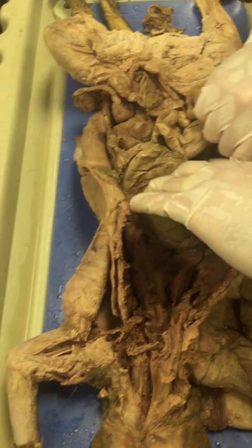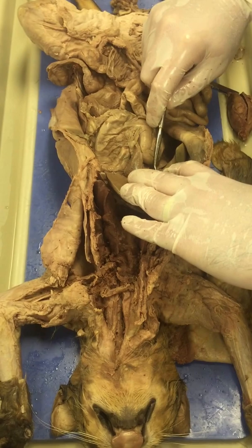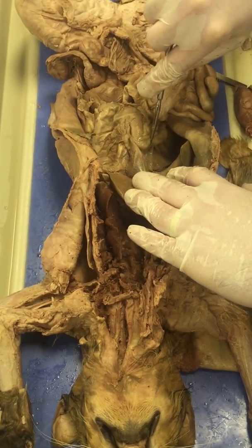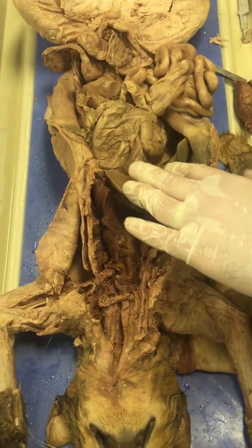And from the gallbladder, bile is released through the bile duct, which you can see right here. Here's the bile duct, this little tube right here. And then it enters into the duodenum right here. You can actually see where it enters. It goes and attaches right here in the duodenum.